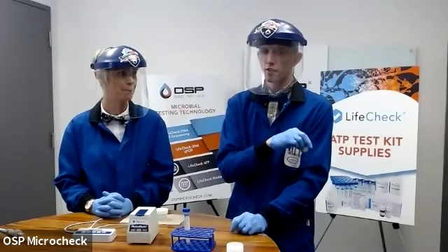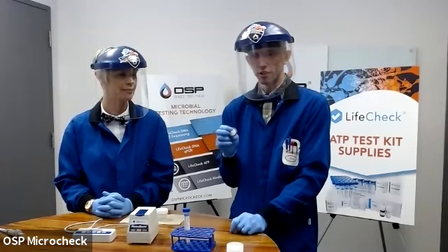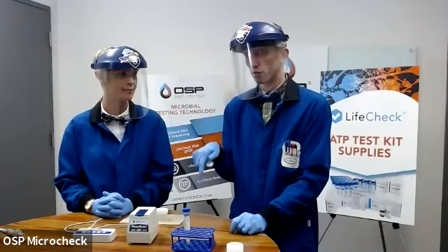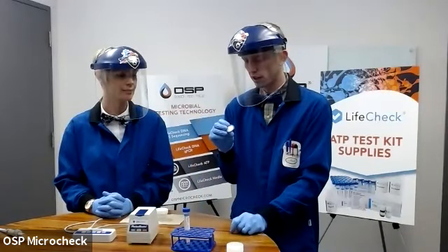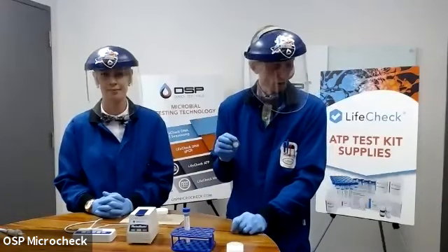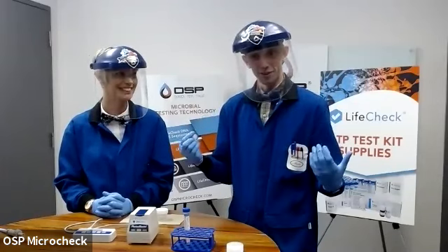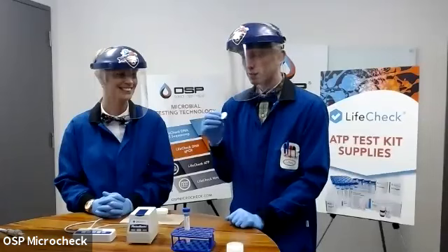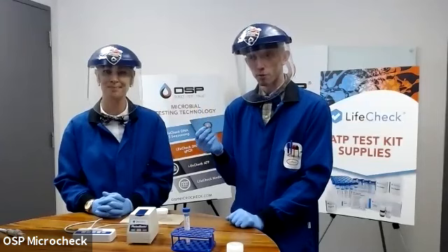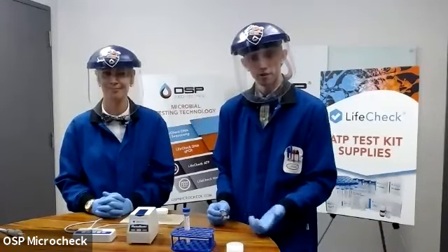And we do actually have a methodology to help you deal with samples that are so viscous that filtration just really wouldn't be the best way to go. So we will go into that as soon as we finish with this demonstration here, and we'll talk about that option. But to the person that asked that question, that's a very valid point. So I don't advocate that you push so hard on your caulking gun that you blow anything up. It certainly makes a mess. It's really more in that situation where you're doing maybe a dozen different samples that are a little bit more viscous, and frankly, it just gets tiresome to try to filter syringe that without some mechanical advantage.